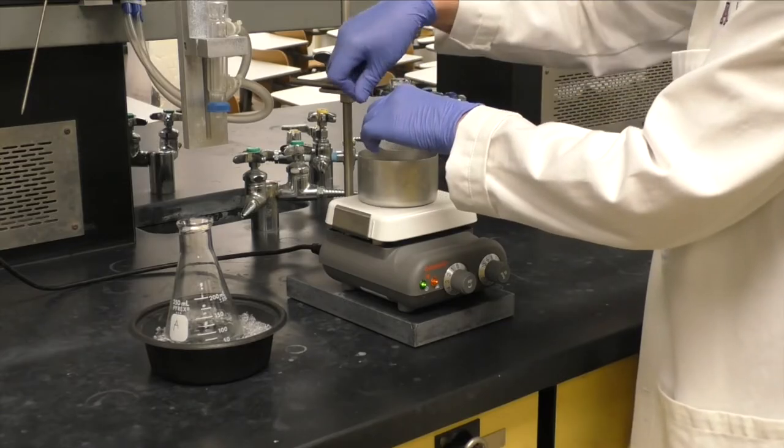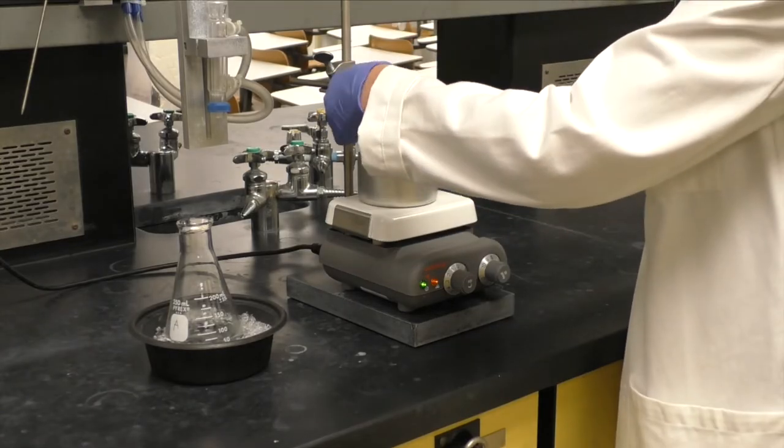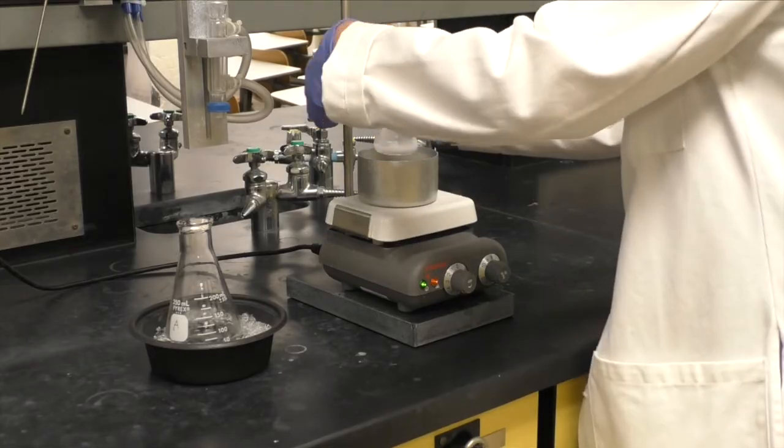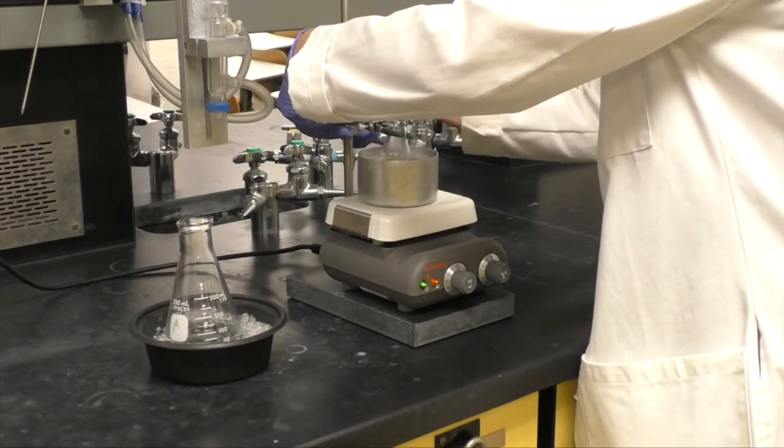Clamp your flask to the ring stand and add a stir bar. Heat with stirring for 15 minutes in your hot water bath.